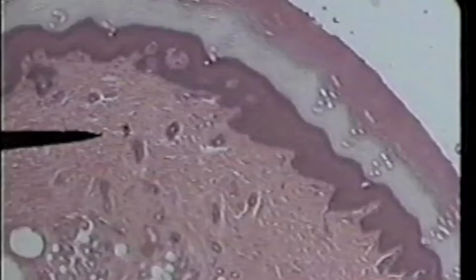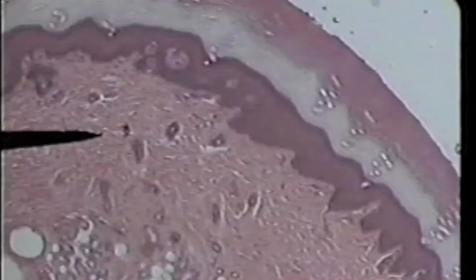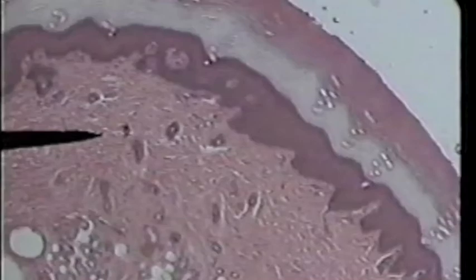This layer in the center is dense irregular connective tissue. Now we'll go to high power and get a sense of why it's called irregular connective tissue.